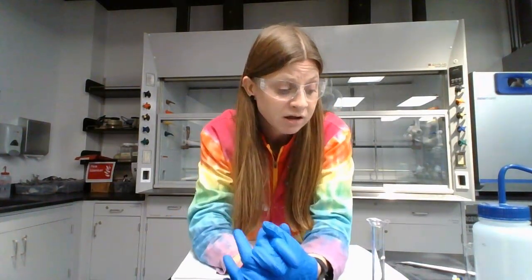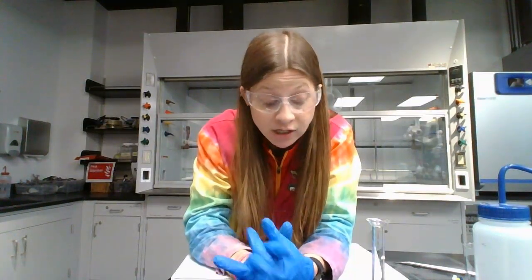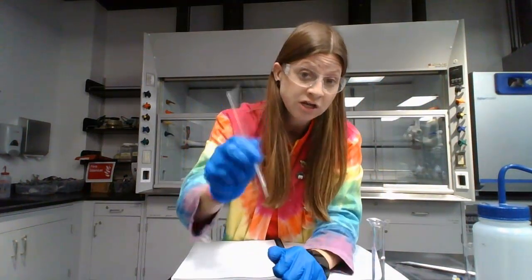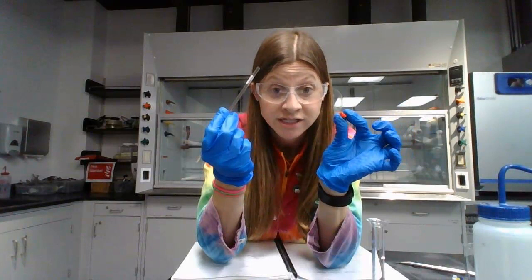So in terms of cleaning up, everything is going to go down the drain because it's salt, water, and Pedialyte or chicken broth. The NMR tubes, when you're finished with measuring the NMR, you're going to take the lids off and turn them upside down and shake them over the sink until you get the liquid out. It's going to take a little bit of shaking. These and the lids will have a special container for you to put them in.